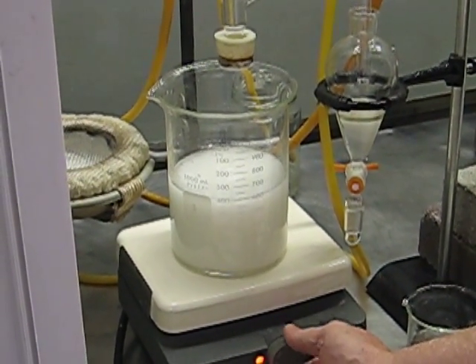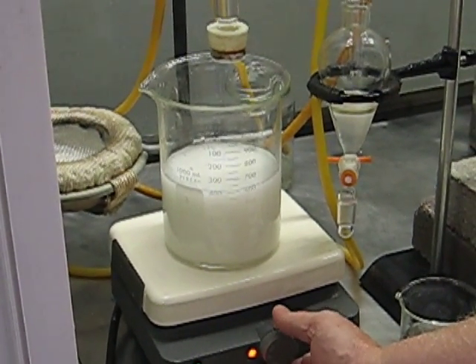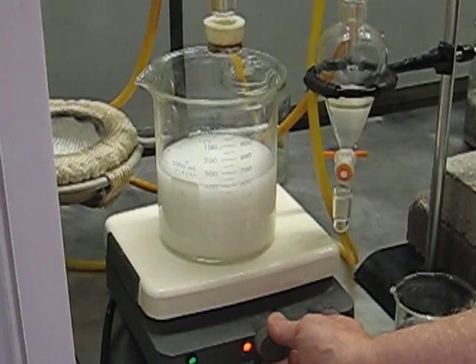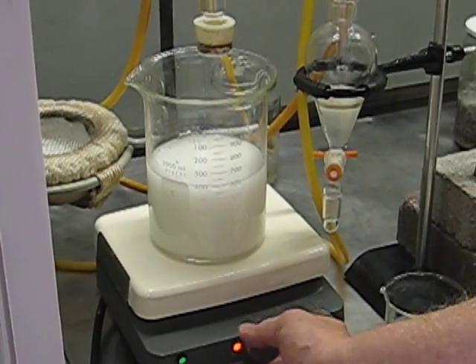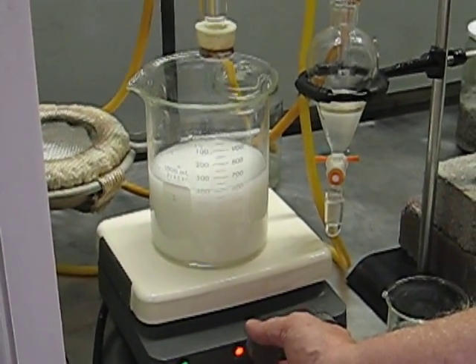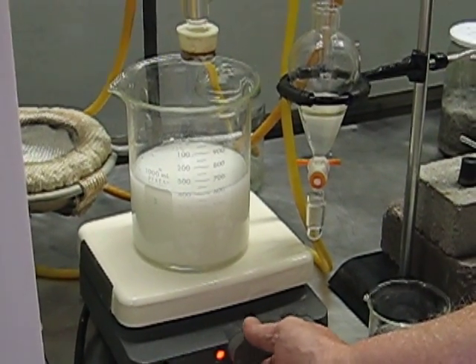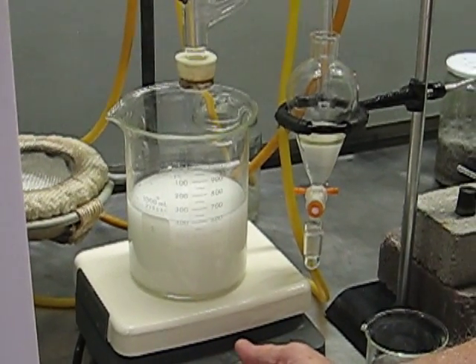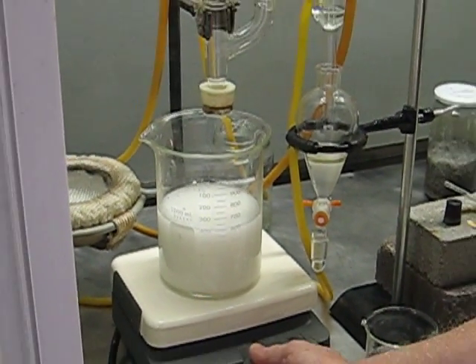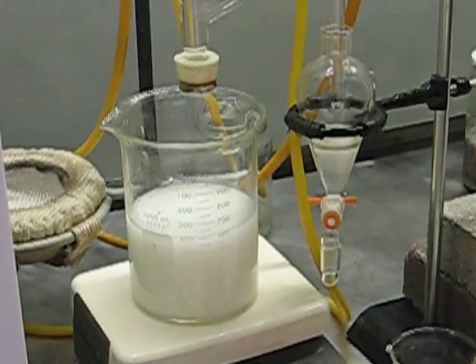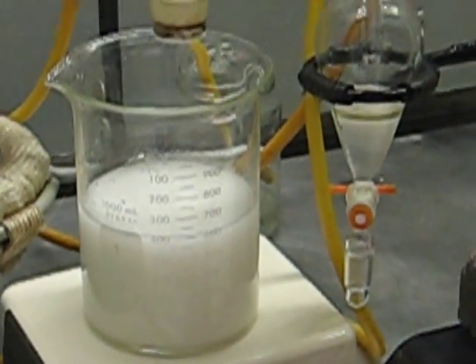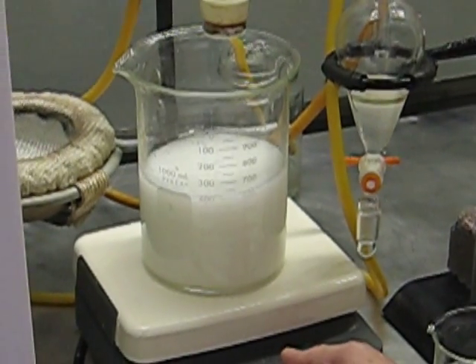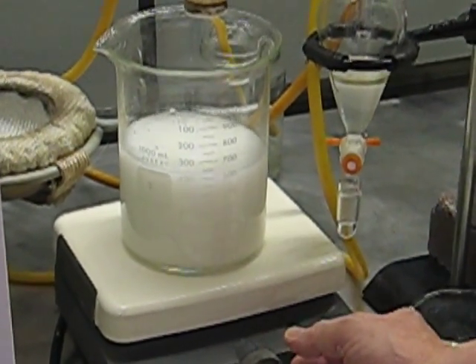It's pretty sensitive. I may have to just go with it in the wild one here. I suppose you're running out of time here. You can put it on hold for a minute so I get this thing stabilized.